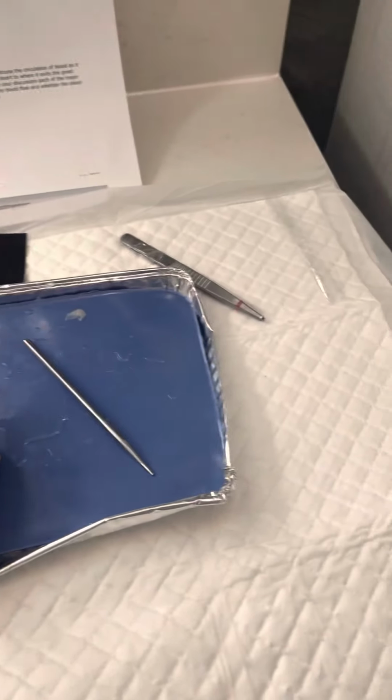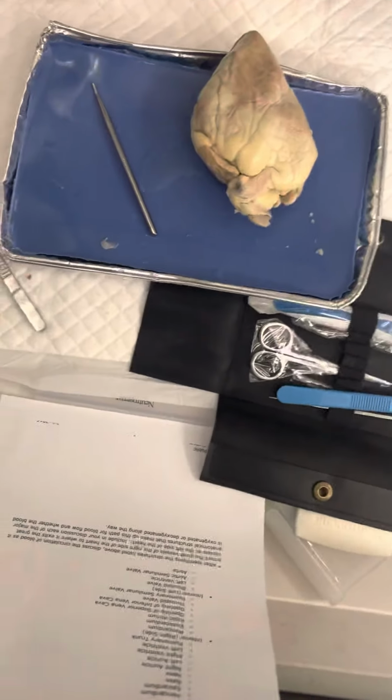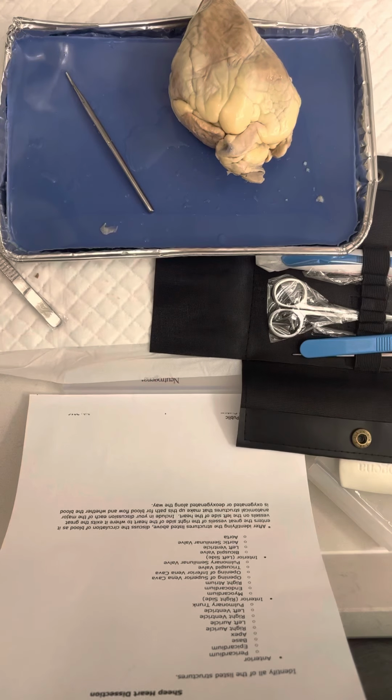This is what I have around me right now. This is my sheet, and this is the rest. And yes, I'm currently in a hotel. This is what I have to deal with. But anyway, let's get started. Oh, that almost fell.